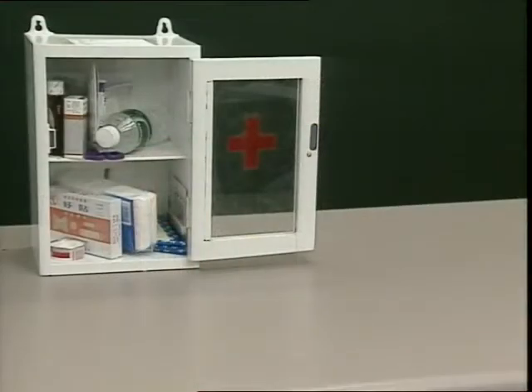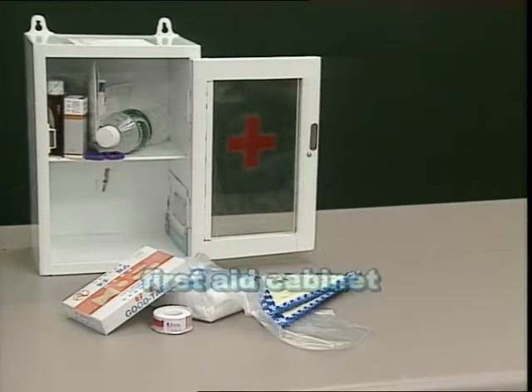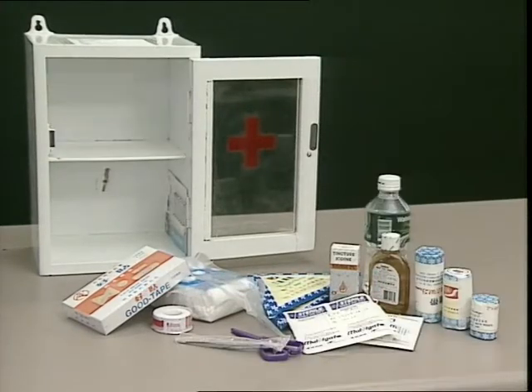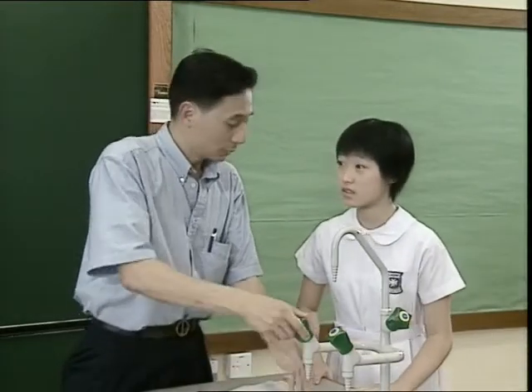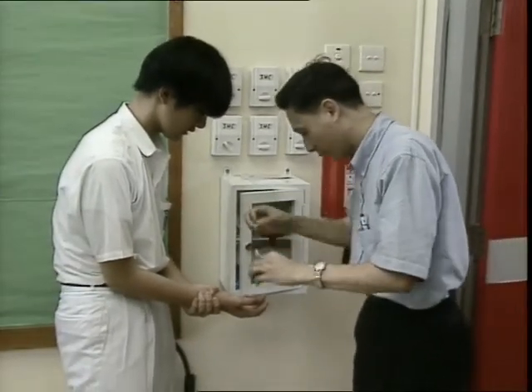First aid equipment should be available in the laboratory. This includes the first aid cabinet, in which bandages, scissors, antiseptics, cotton wool, etc. are stored. In the case of accidents, students should immediately report to the teacher or the laboratory technician in charge. First aid treatment should be given according to the situation.